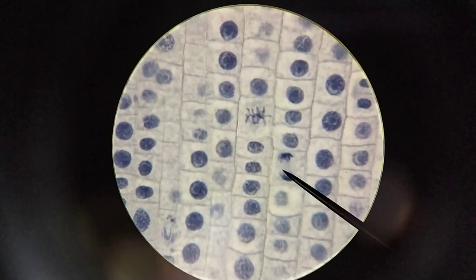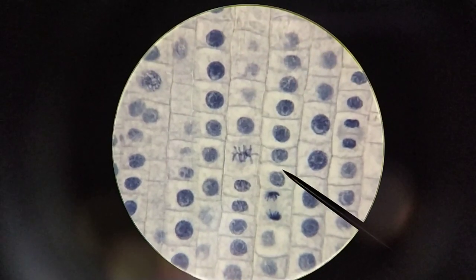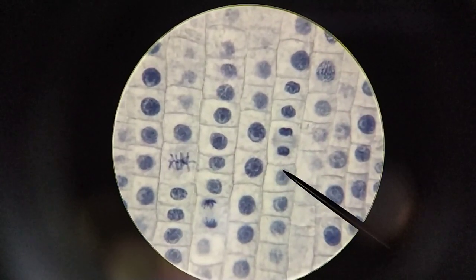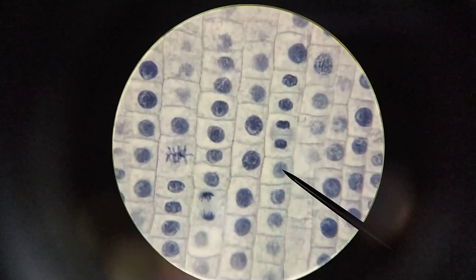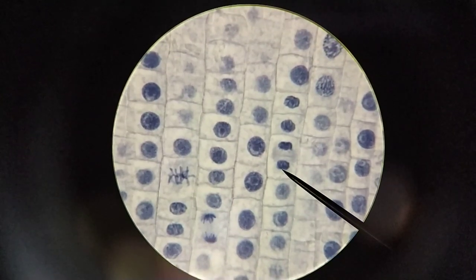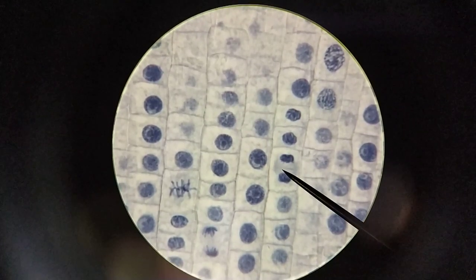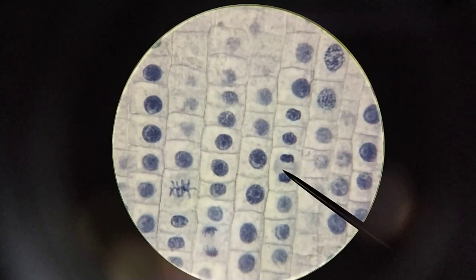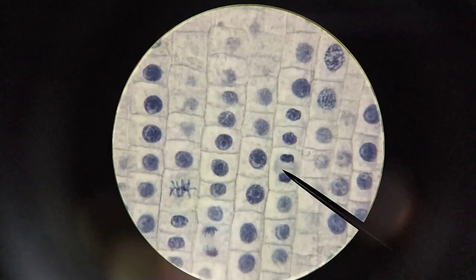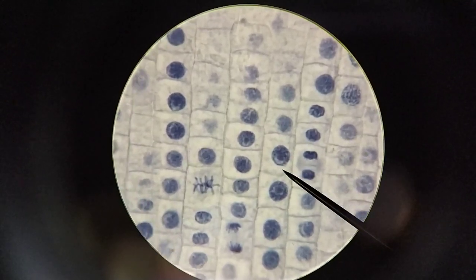Just below we can see another cell undergoing anaphase. Here we're seeing two nuclei reforming, and in between them we start to see evidence of a cell wall forming. We're looking at telophase - at the end of telophase we're looking at cytokinesis, the formation of a cell wall between the two newly developed cells.